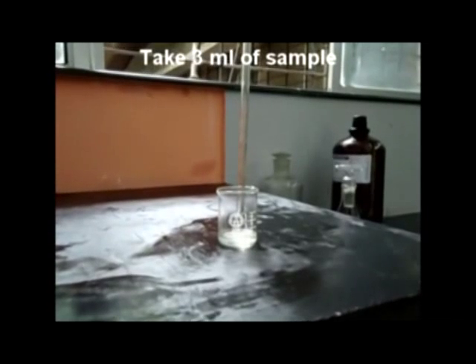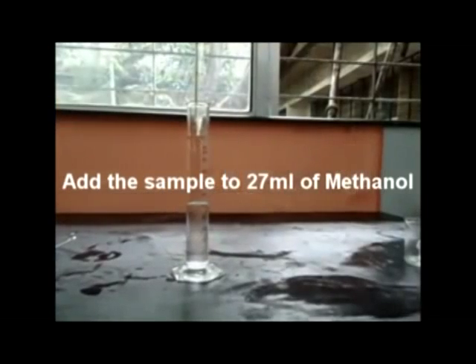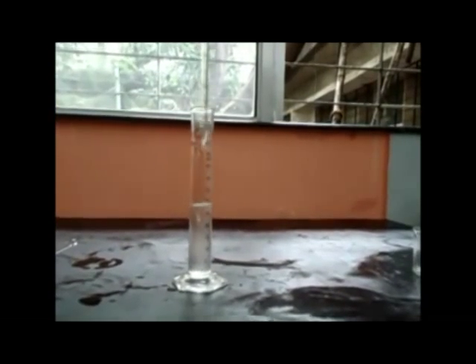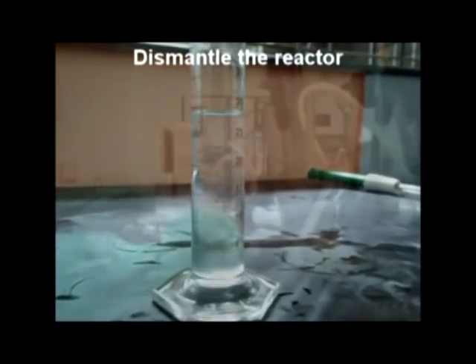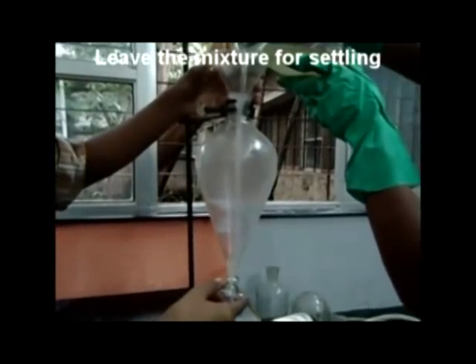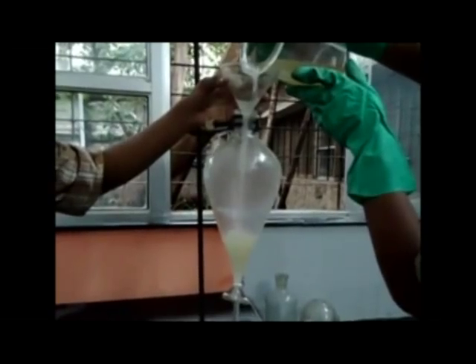After 2 and a half hours, take a sample from the reactor and pipette out 3 ml of sample. Put it into a measuring cylinder containing 27 ml of methanol, stir thoroughly, and leave for 5–10 minutes. If there is no layer separation, this indicates that transesterification is complete. Dismantle the reactor and transfer the reaction mixture for settling into the separating funnel, in a way similar to esterification.